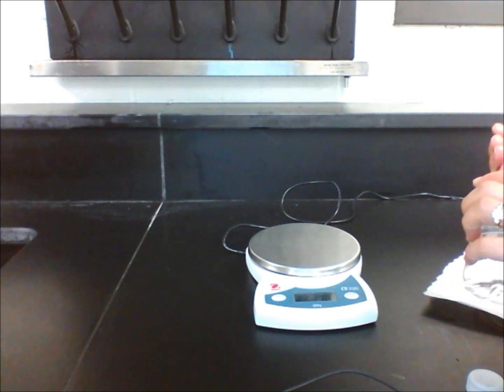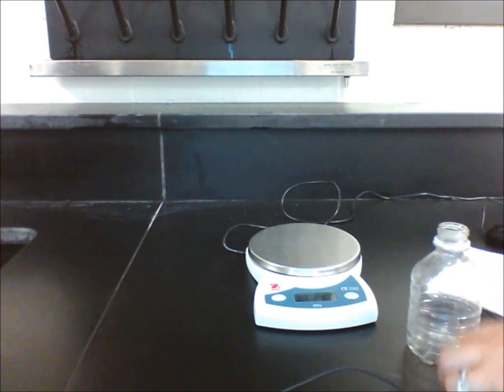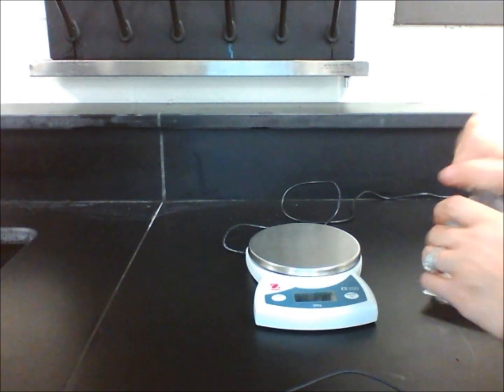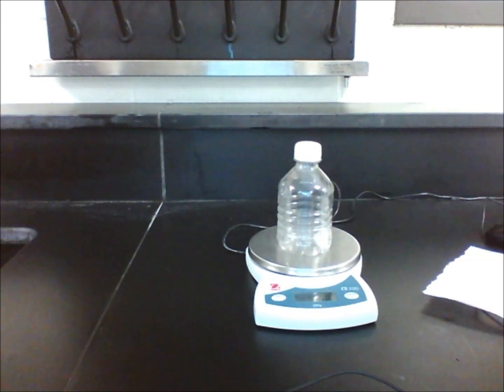First, put the equivalent of about two cubes of crushed ice in the plastic bottle. Screw on the lid and weigh the apparatus on the scale. Record the mass.